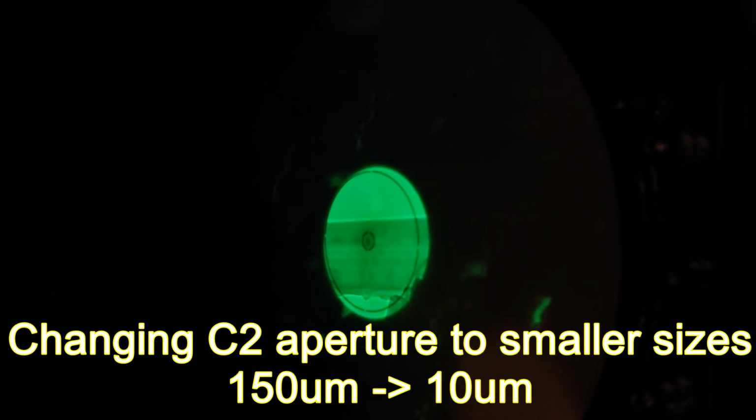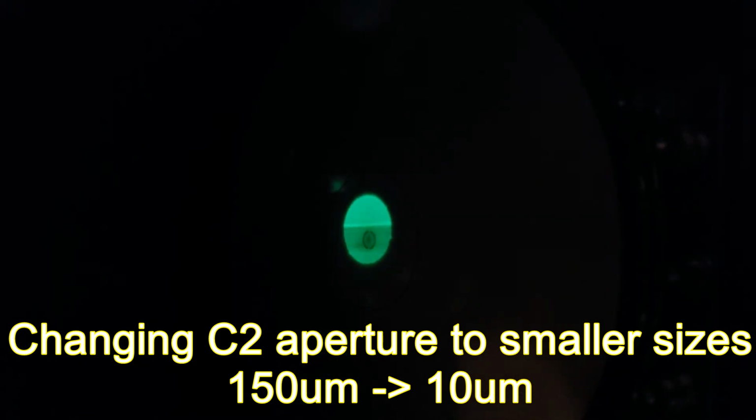This is a large condenser aperture. Now I'm going to change the condenser apertures. I go to a smaller size, and you see the field of view is now smaller and smaller. Move the specimen in, and the smallest one here. So the field of view is tiny. I can expand it by changing the condenser aperture, but I'm no longer then in parallel illumination. So I go back to the big one.